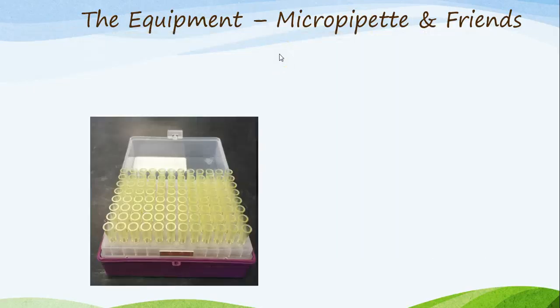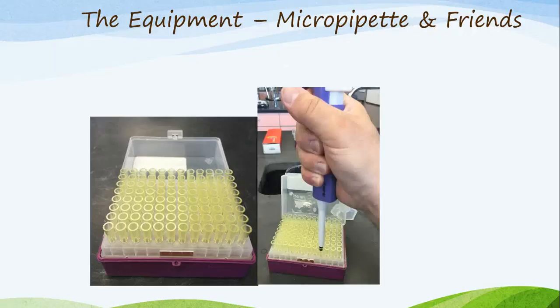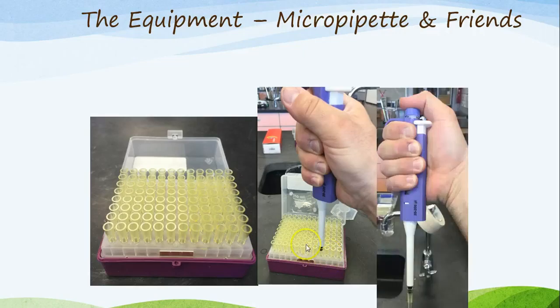Other things you're going to need to know. These are micropipette tips. Micropipette tips get put on the end of the micropipette. How do you do this, you say? You hold the micropipette in your hand and you insert the micropipette into the tip, pushing hard into the tray, and the tip will then be on the bottom of the micropipette. Notice in this example the precision handling and expertise demonstrated with a micropipette. Fingers underneath the hand guard or hand rest, thumb on top of the plunger. He can read the screen if necessary.